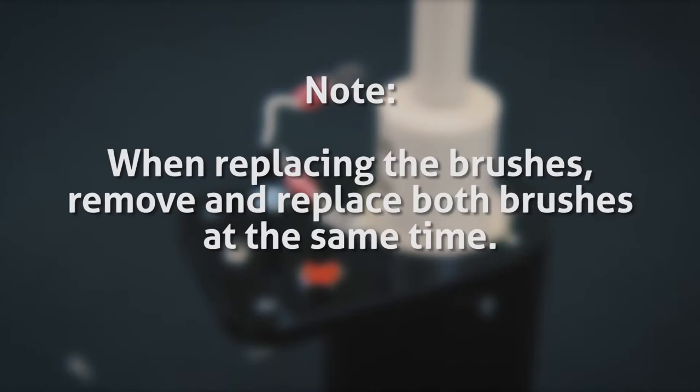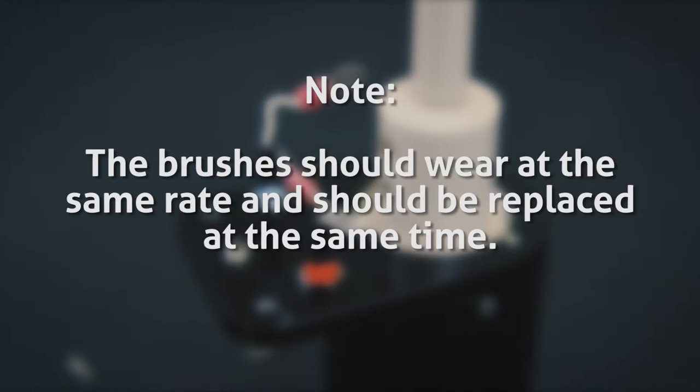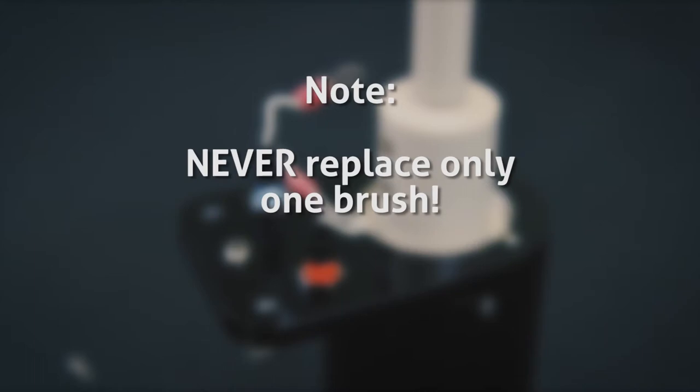When replacing the brushes, remove and replace both brushes at the same time. The brushes should wear at the same rate, hence both should be replaced at the same time. Never replace only one brush.